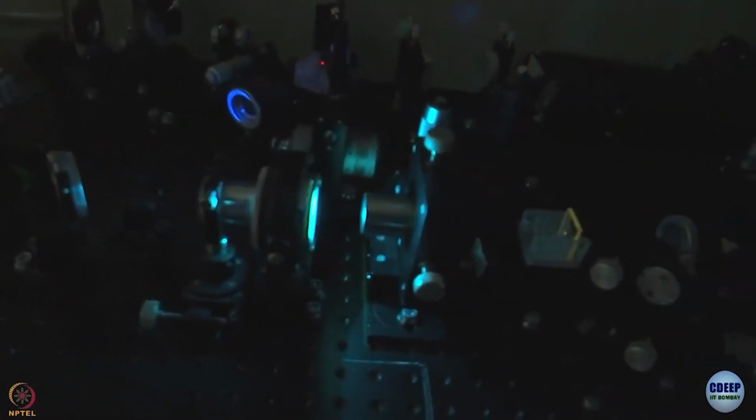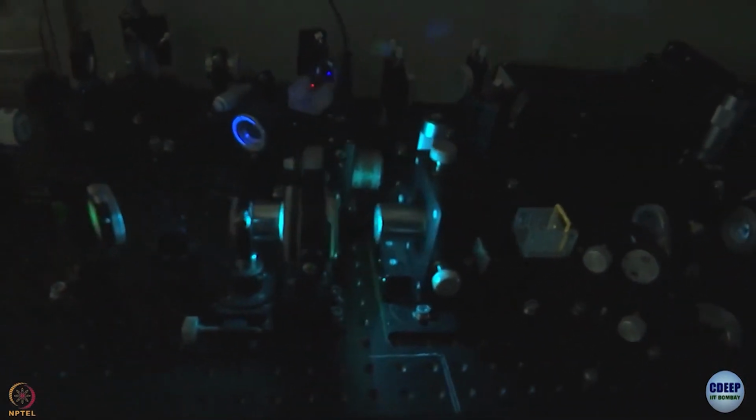The moment I remove this barrier, you will see the fluorescence of the sample yourself, and that is because right now we are using a standard sample which is very highly fluorescent. There you go. So, the bright light that you can see is that of the fluorescence. And from this side, if you look, you can actually see a spot that is brightest. That spot is where the blue light is focused, and that is why the fluorescence from that spot is what we are actually collecting. Everything else is a glow arising from there.